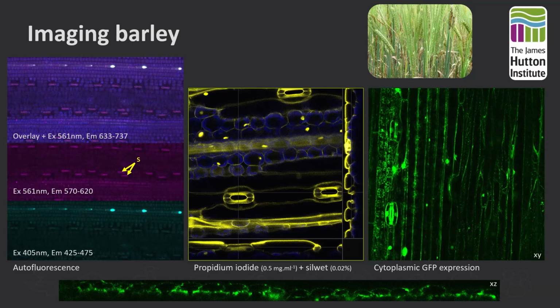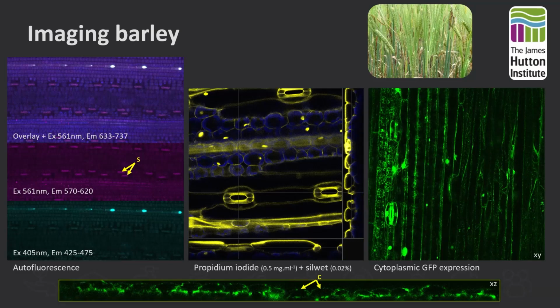Even if the tissue is stained, imaging is challenging. These epidermal cells only contain a very thin layer of cytoplasm. And as we can see in this XZ section, without depth compensation, the fluorescence signal is rapidly quenched in the underlying mesophyll cells. You will also notice that this tissue is not flat, meaning we were looking at very deep Z sections.